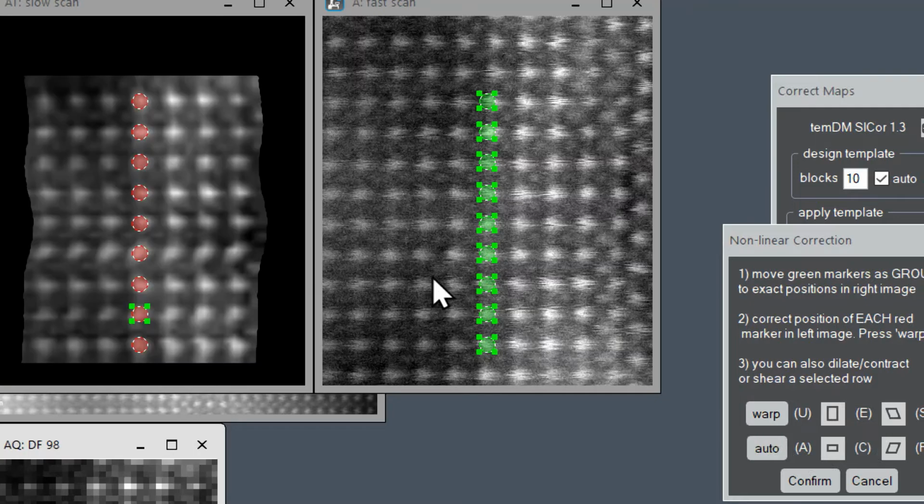Press warp again. It's an iterative process. Still, I'm not very satisfied, but final tuning is better done accurately. I think it's better to select a given marker and move it with arrow buttons. Something like that. Yeah. Again warp. Maybe this should be corrected more. Warp. Still. Okay. Well, you can do that for a long time. It depends on the quality you finally are going to obtain.